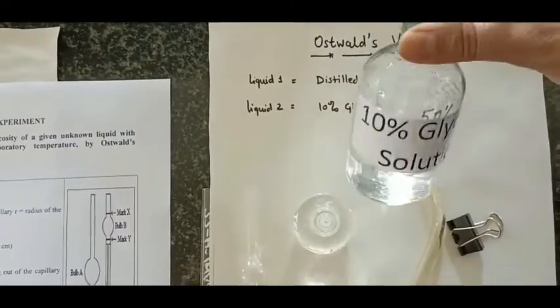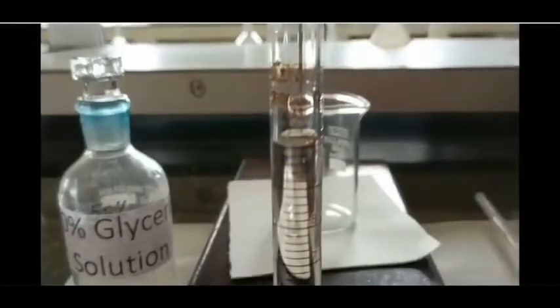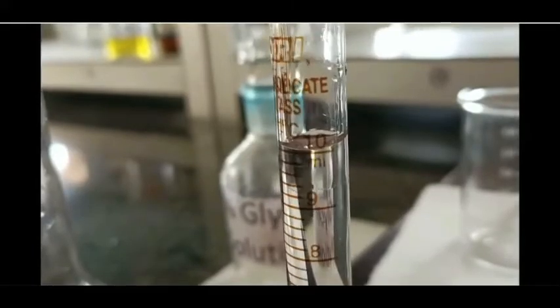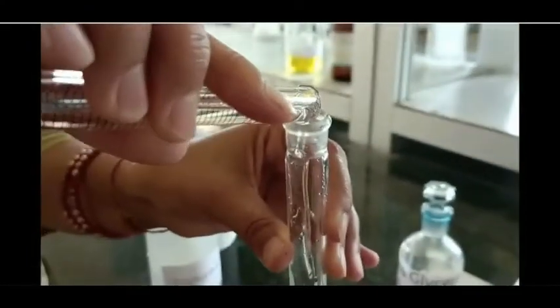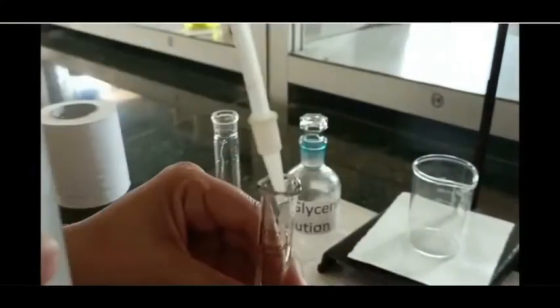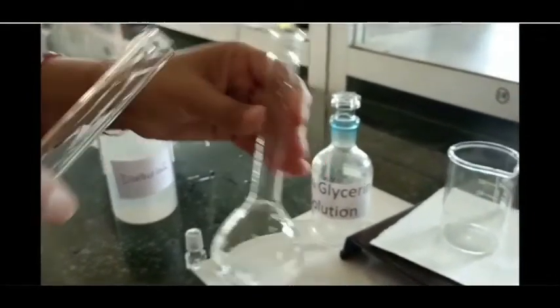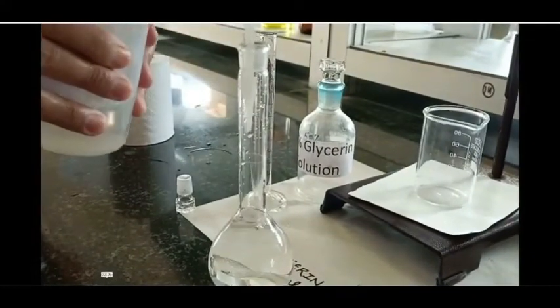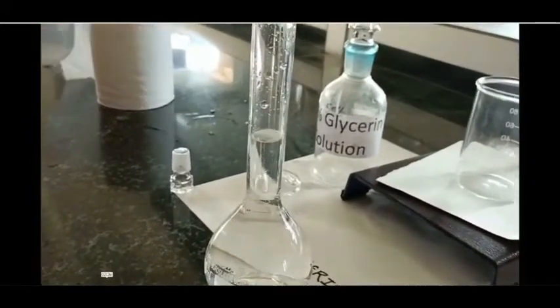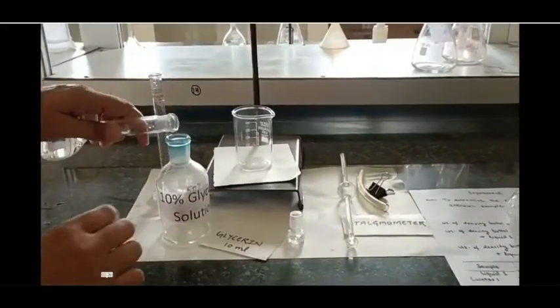Liquid two is a 10% glycerin solution. I am going to tell you how to prepare it. I have taken 10 ml glycerin in a measuring cylinder, reading the lower meniscus, and I am transferring this into a 100 ml measuring flask. I will rinse the measuring cylinder two or three times and transfer to the same flask, dissolving it thoroughly and making up the solution to 100 ml. This is our 10% glycerin solution. I will now transfer it into the reagent bottle.